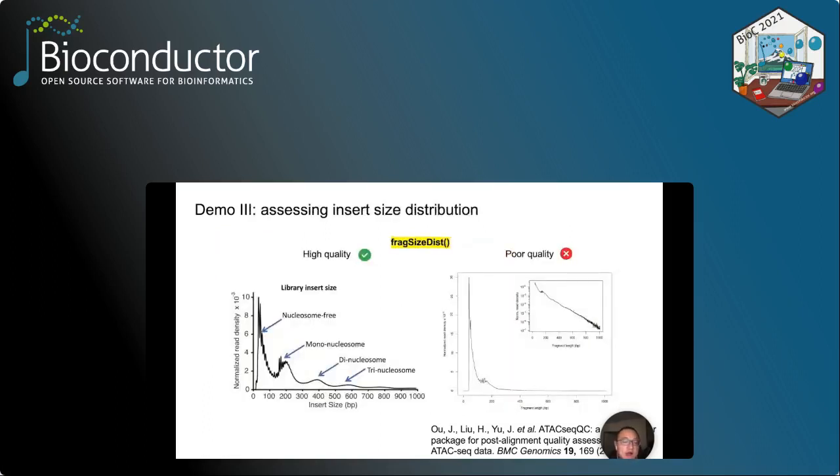As we discussed earlier, a good quality ATAC data will exhibit a distinct fragment size distribution pattern as shown on the left. Basically, as you can imagine, since most of the reads come from the nucleosome-free region, you can see the largest peak below the 100 base pair range. And there is also a smaller peak around the 200 base pair range, which represents the fragments that contain mononucleosome. There is an even smaller peak around the 400 base pair, which represents the fragments that contain dinucleosome, and so on and so forth. In contrast, for the poor quality data, you won't be able to see such distinct pattern.